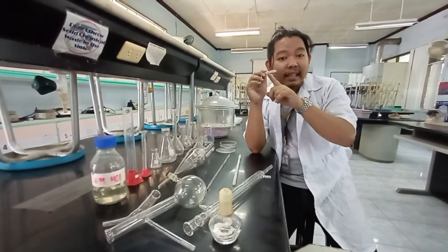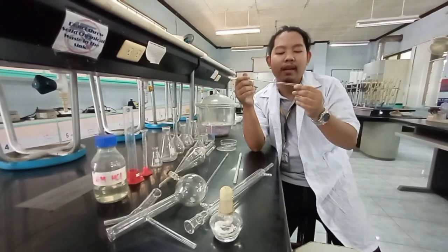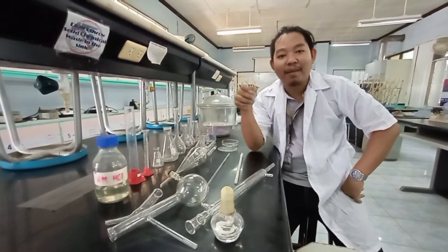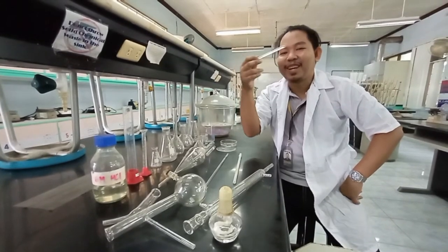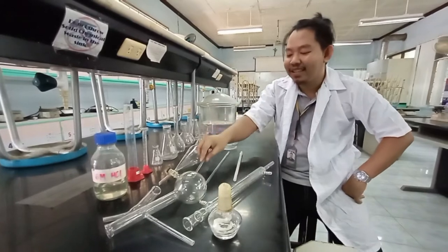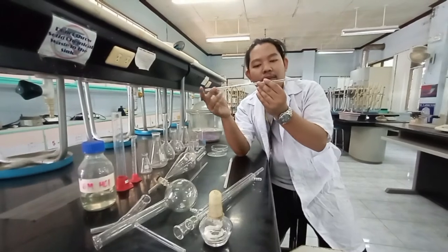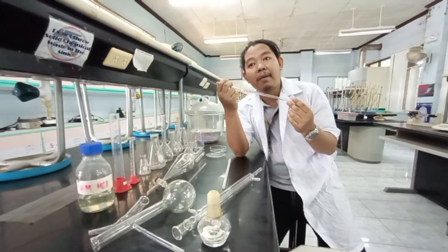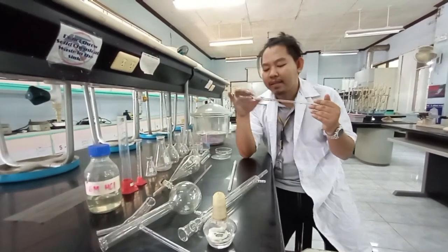We use the stirring rod to guide the flow of liquid, or to stir and mix some liquids. And we have here the pipette. This is what we use to get some liquid, with the help of a rubber aspirator. I'll show you how to use it with your thumb and the rubber aspirator soon.